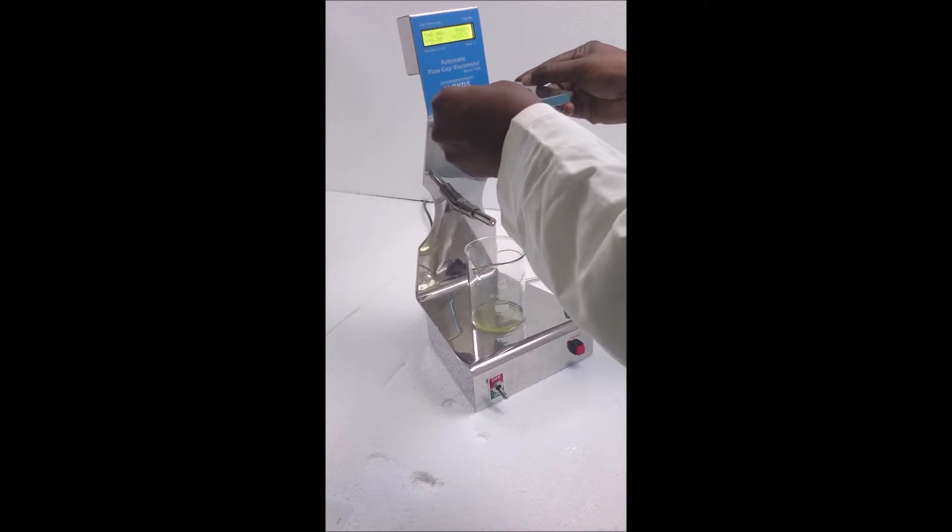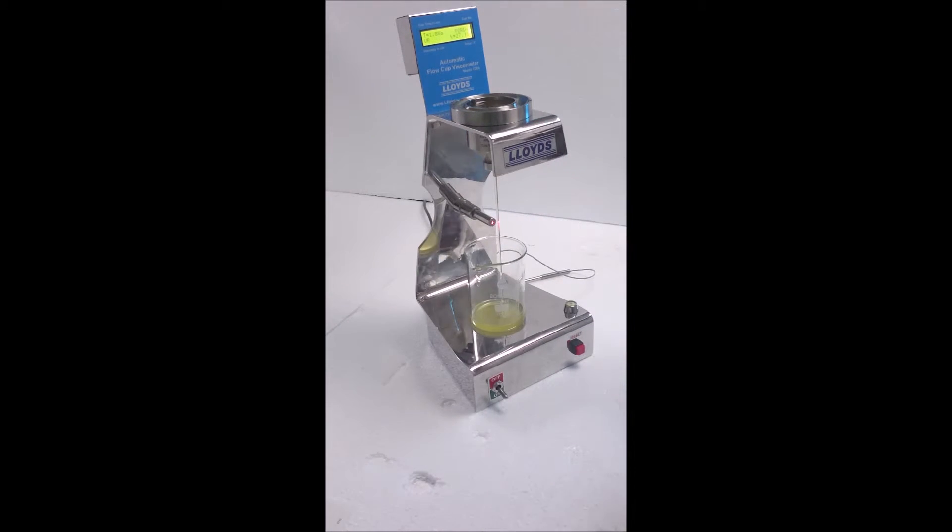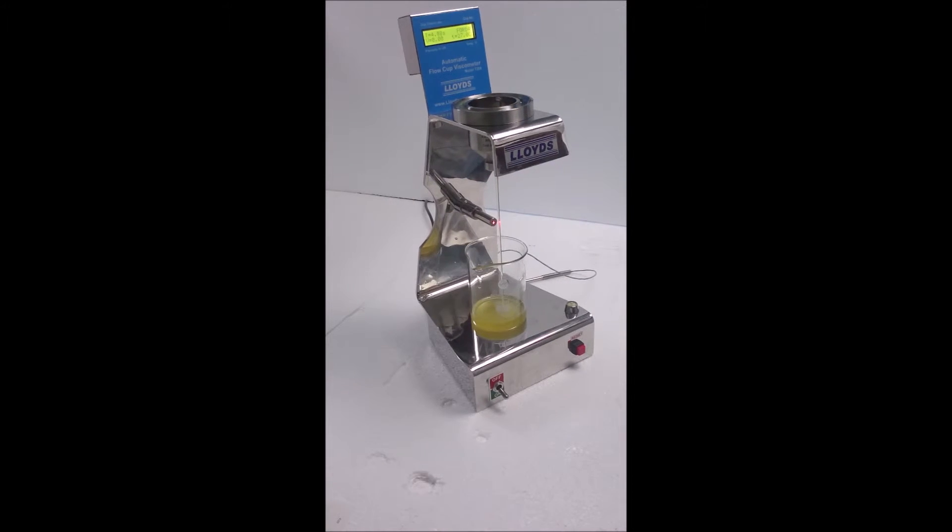Breakpoint procedure: slide and remove glass plate from the cup and simultaneously the timer starts automatically at the presence of the liquid.